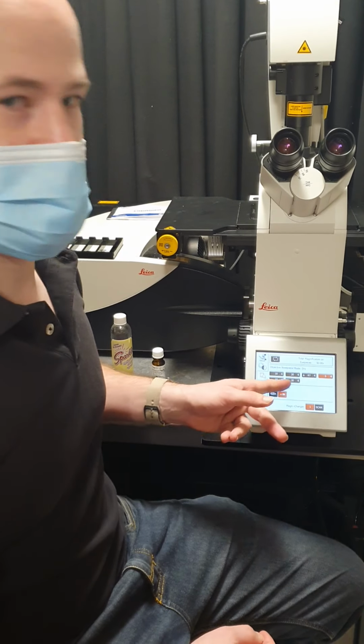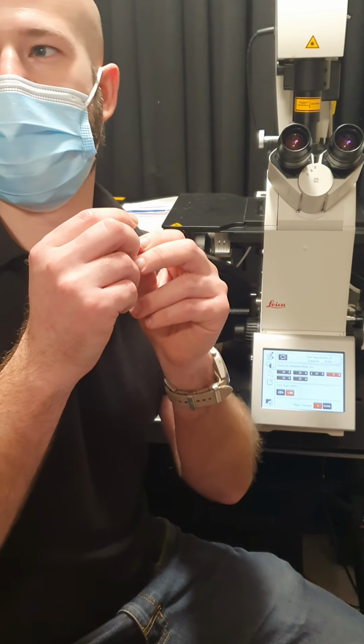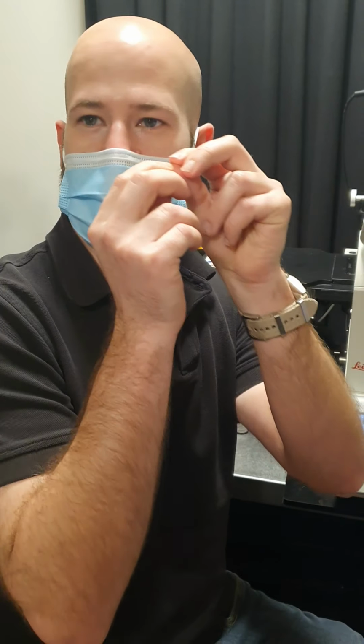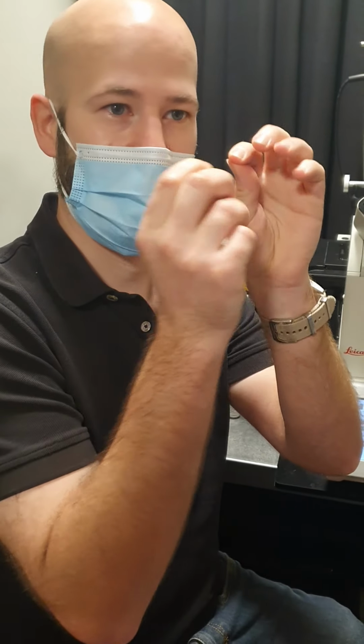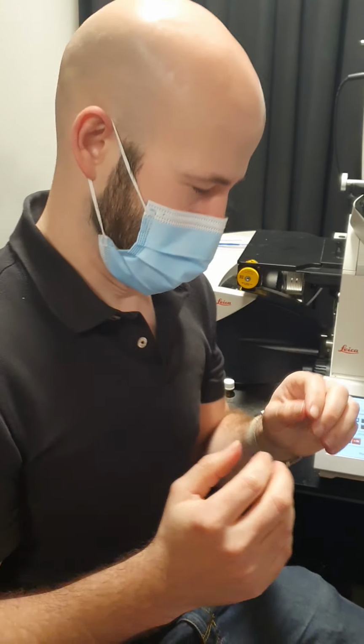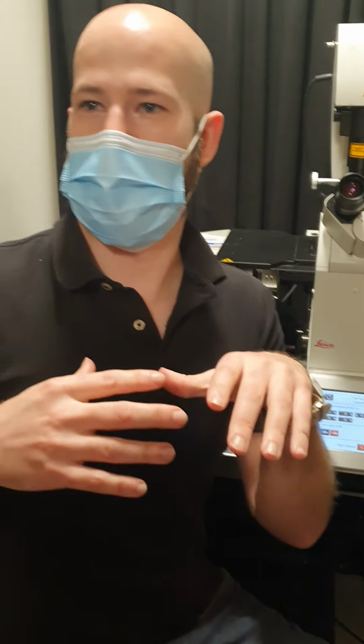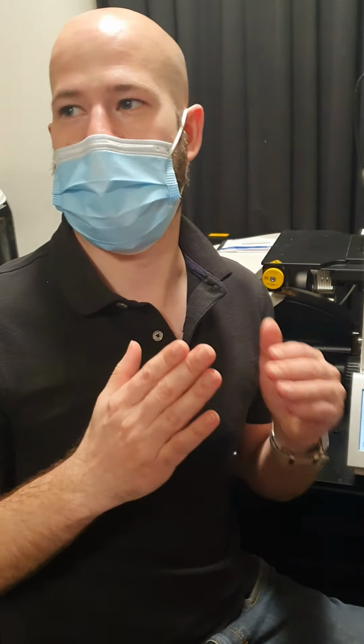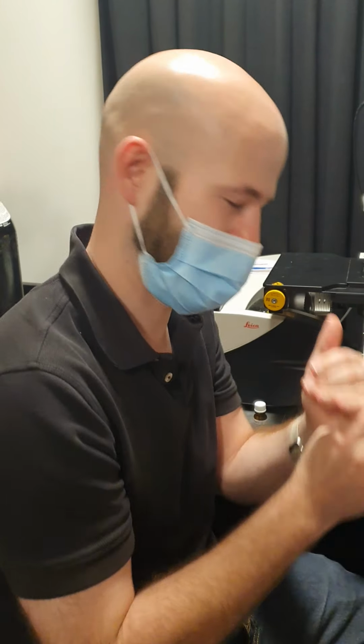And the other difference is that they have a longer working distance, which is the distance between the tip of the objective and the maximum distance it can focus to. The confocal objectives have a very short working distance, so the tip of the objective has to be very close to the focal plane of the sample, which doesn't work well, again, if your samples are, for example, in a multi-well plate, which tends to have a very thick bottom. The higher magnification confocal objectives actually can't focus all the way through that. If you try, you'll just hit the bottom of the plate before you reach focus.